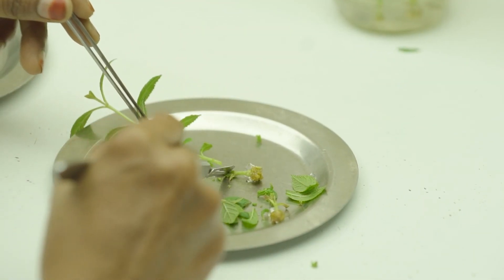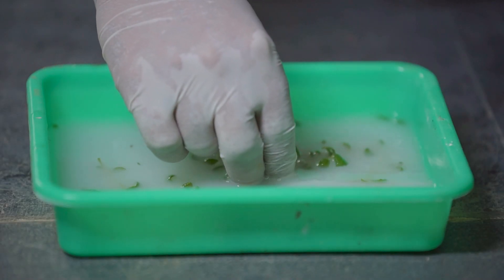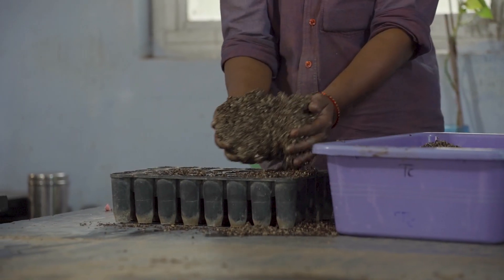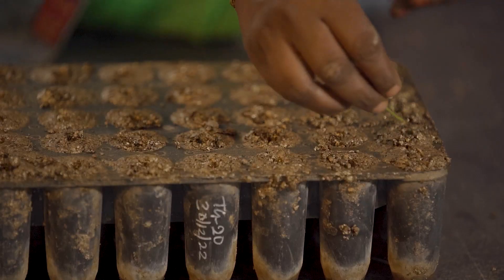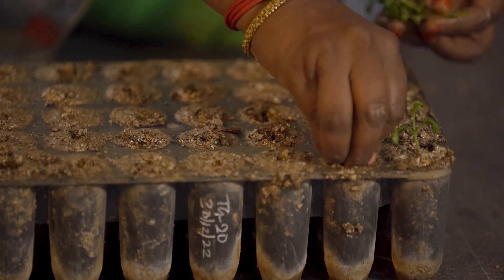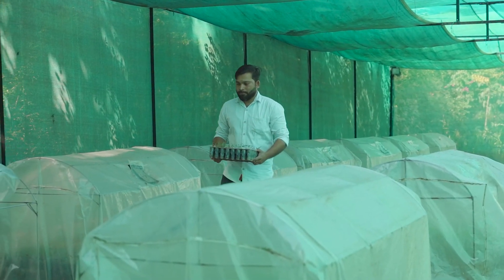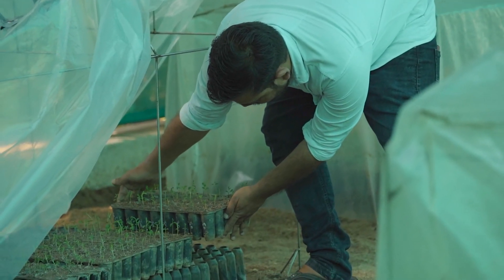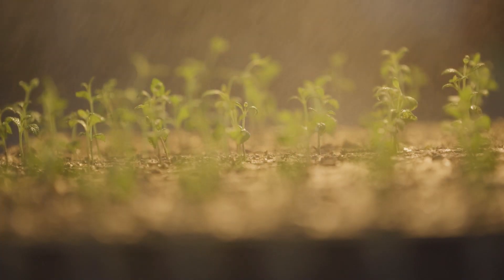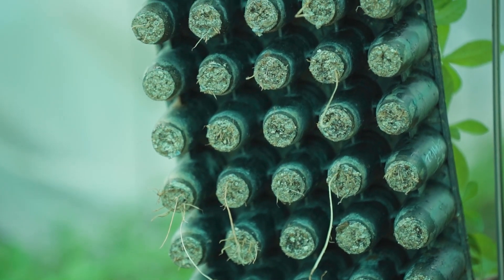Quality shoots are taken to the nursery for rooting. Shoots washed in fungicide are dipped in a rooting hormone and placed in root trainers containing moist vermiculite. The root trainers are placed in tightly closed polytents under a shade house with misting to maintain high humidity. After 20 to 25 days, the roots are formed.